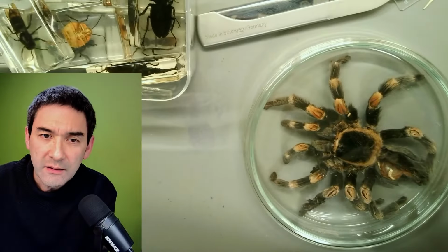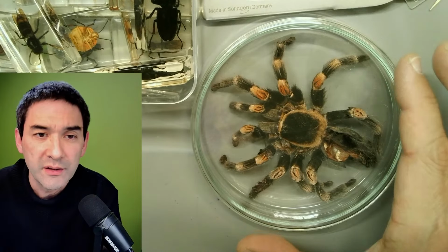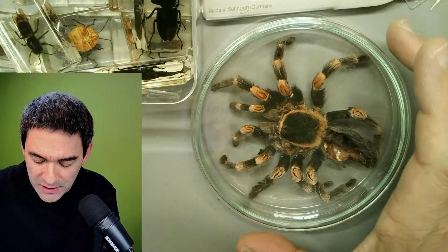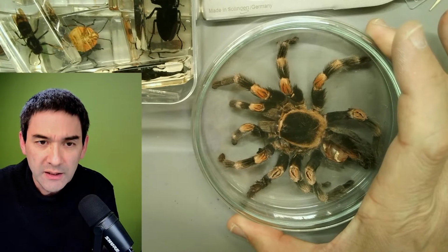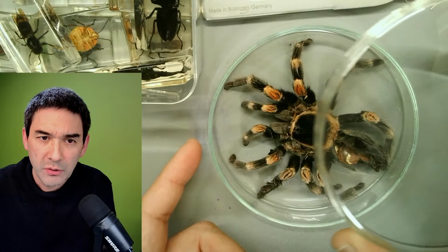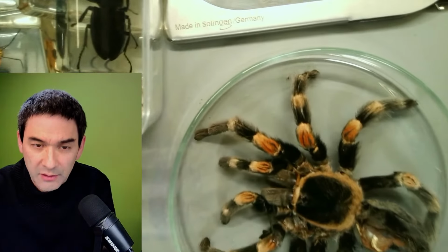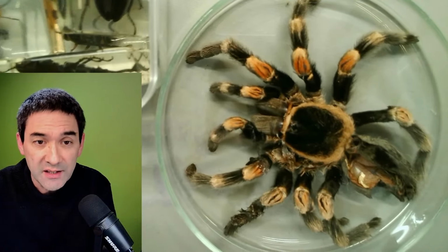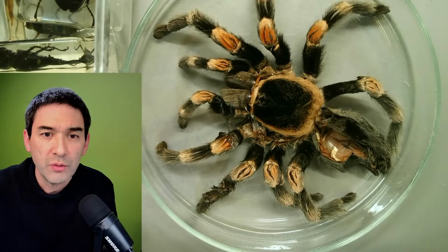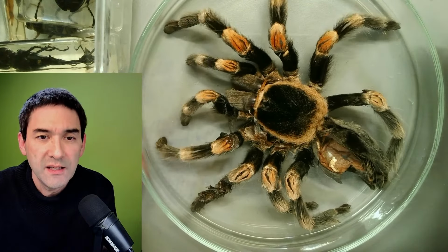And I think all of a sudden they were in the display box, and I think that maybe a teacher or a student brought them along. Maybe they were keeping those spiders, and so this is only the skin, right? It was actually taped closed, the lid, and if you want to have a better look at it, I'm going to remove the lid here. Honestly, I've also not looked at a spider of this size under the microscope before, so I just removed the tape of the lid a few minutes before the start of the stream.